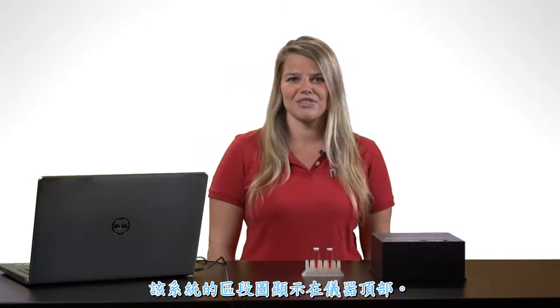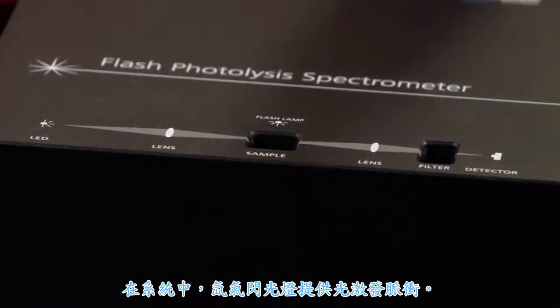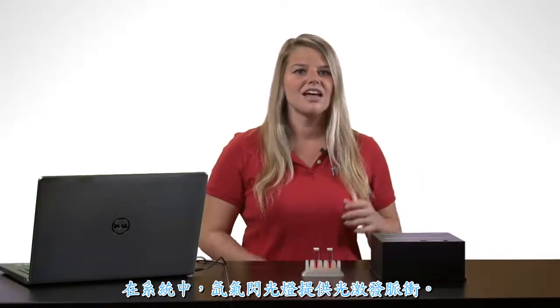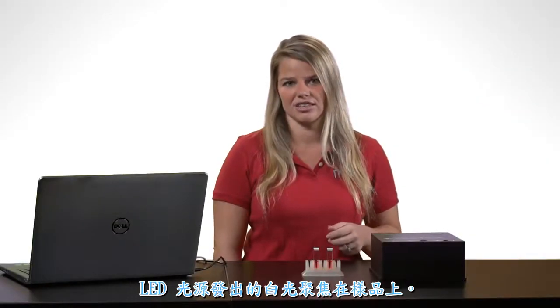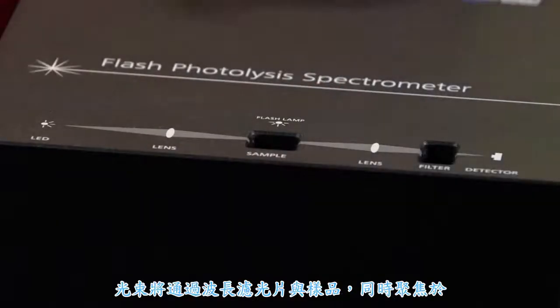A block diagram of this system appears on the top of the instrument. In the system, a xenon flash lamp provides the photoexcitation pulse. Then white light from an LED source probes any spectral changes made in the system by the excitation light pulse. The white light from the LED source is focused on a sample.